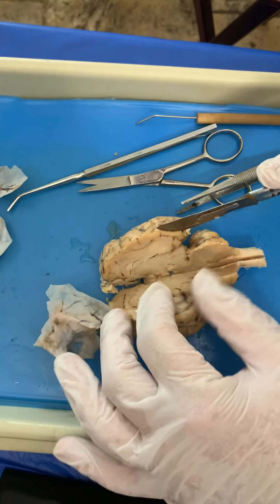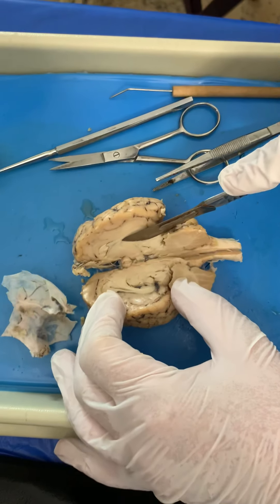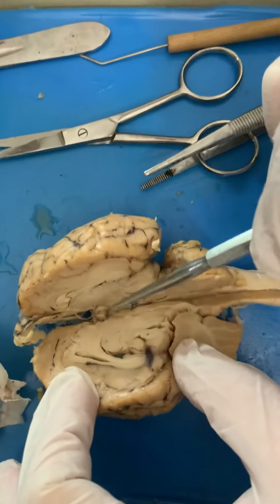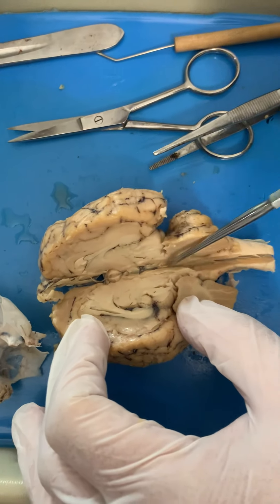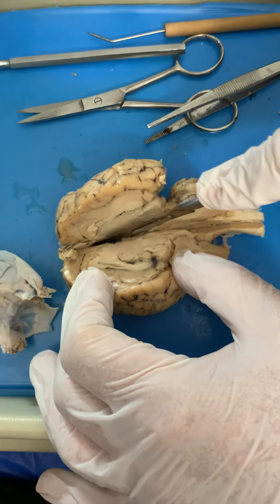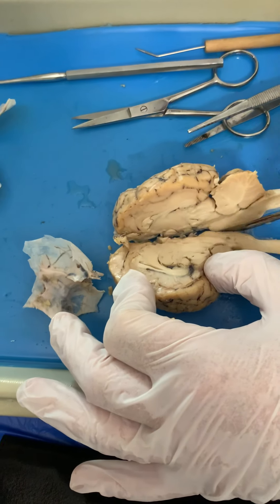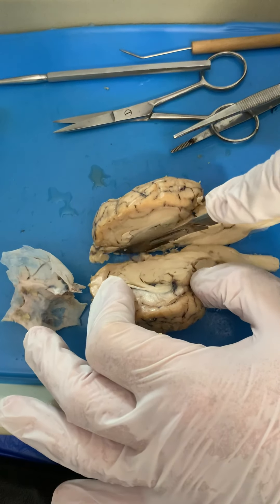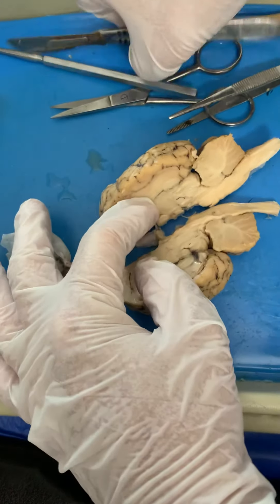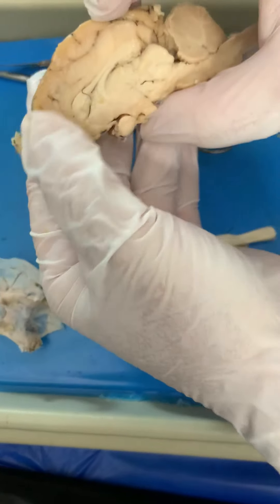All right guys, now we're going to go inside — we're going to split the brain in half. Before I cut it all the way in half, I want you to see your optic chiasma — this is where they were formed here. We're going to slice all the way down your spinal cord so that we have it in half. Even though this is the sheep brain, it is identical pretty much to the human brain.